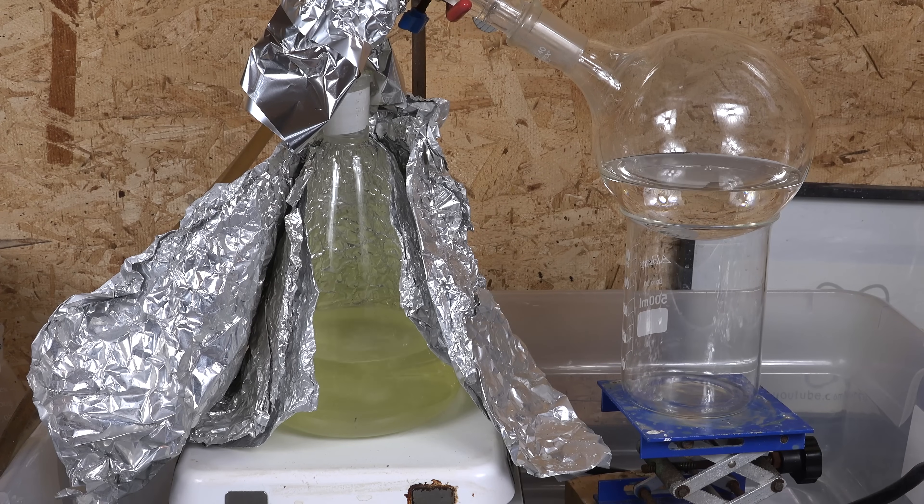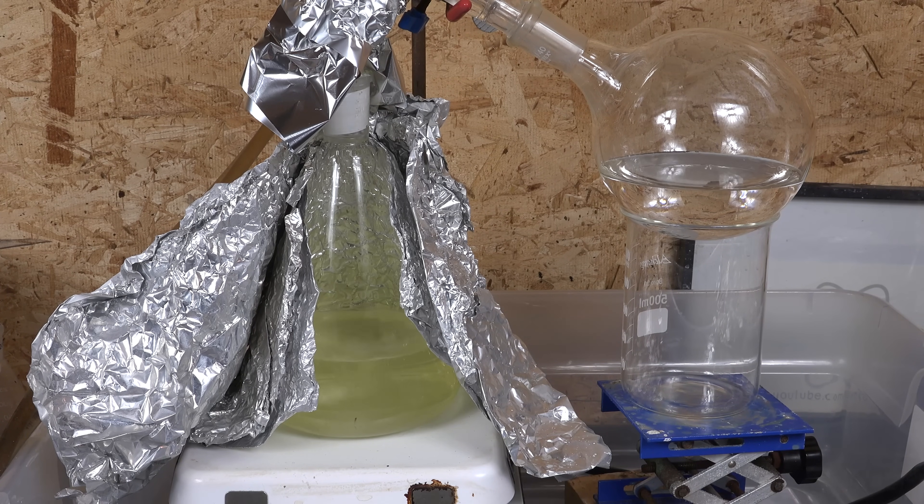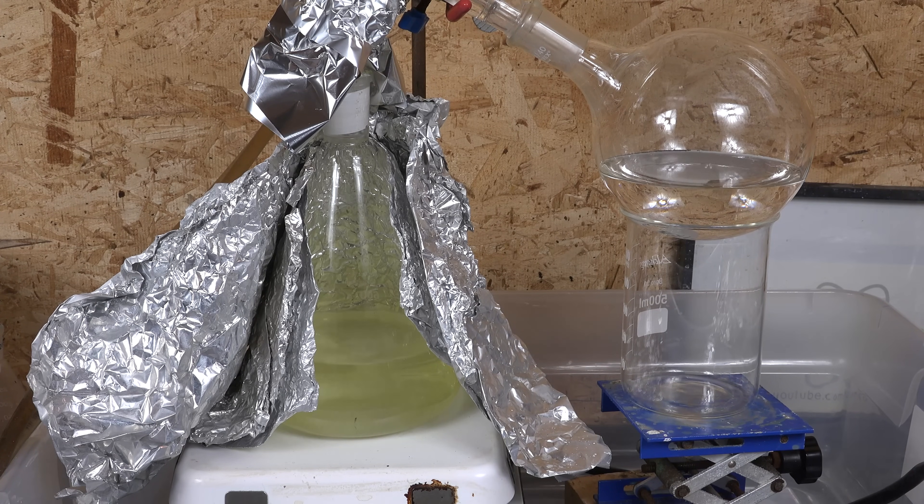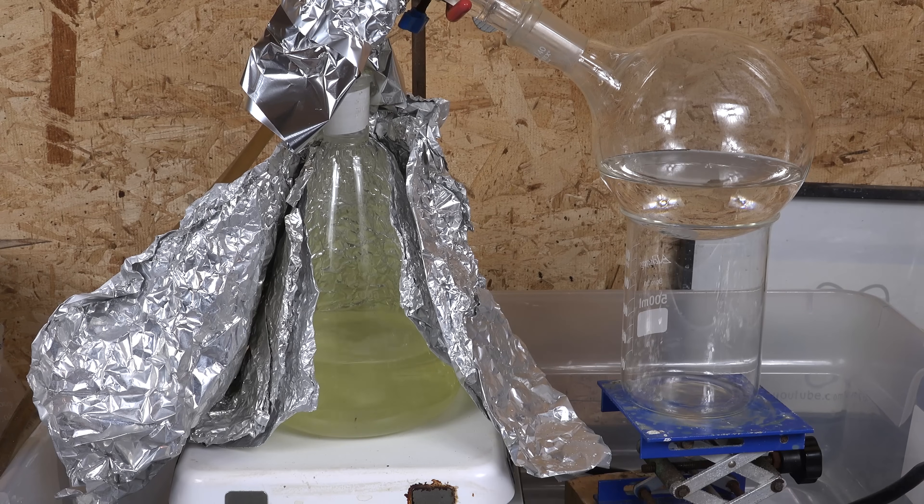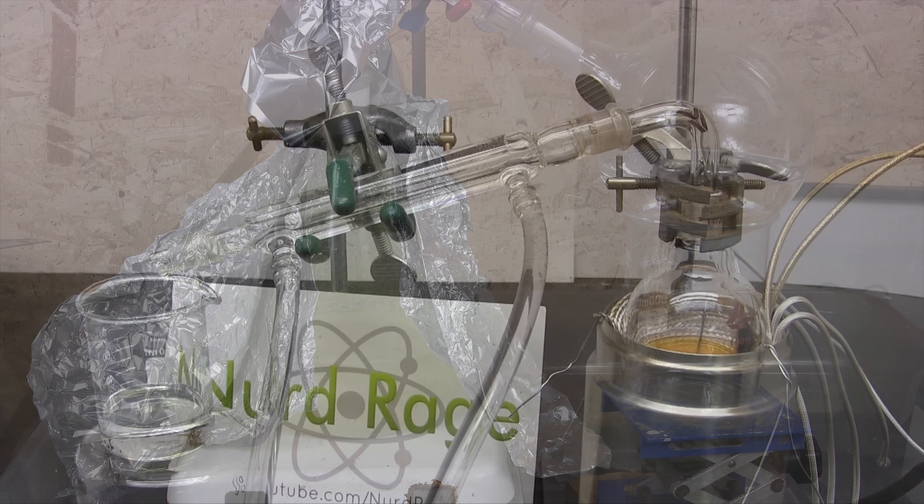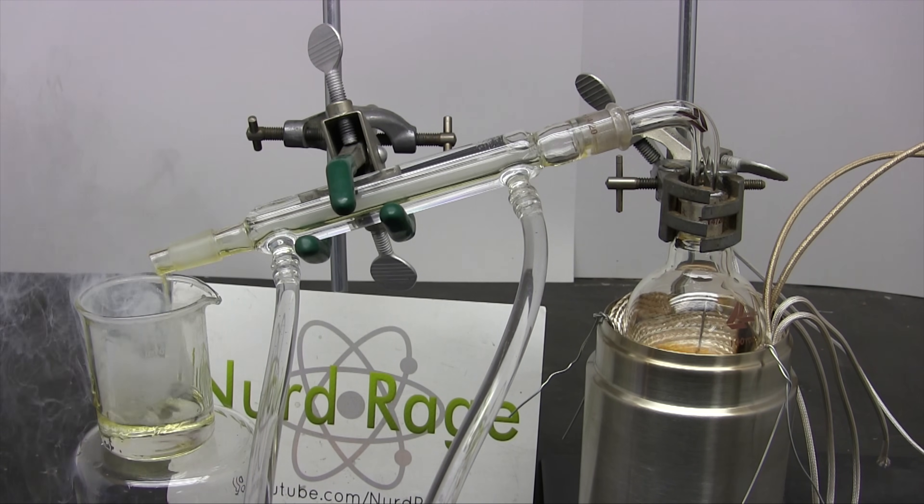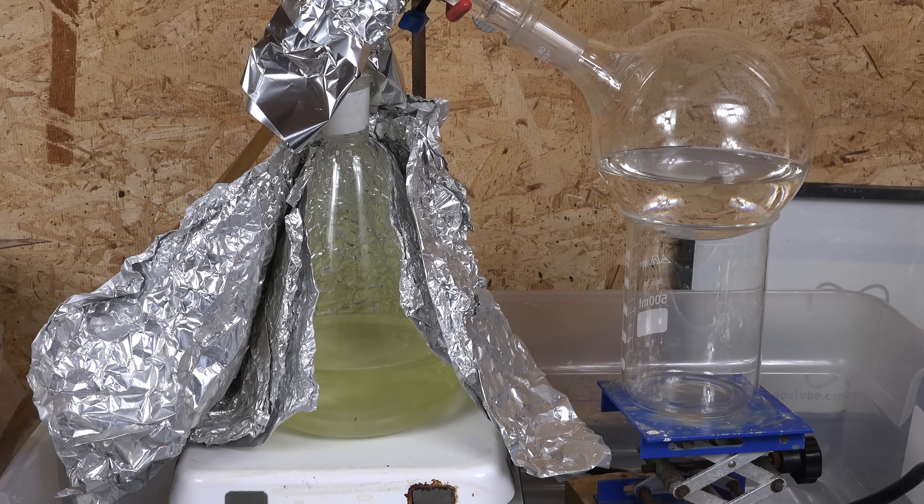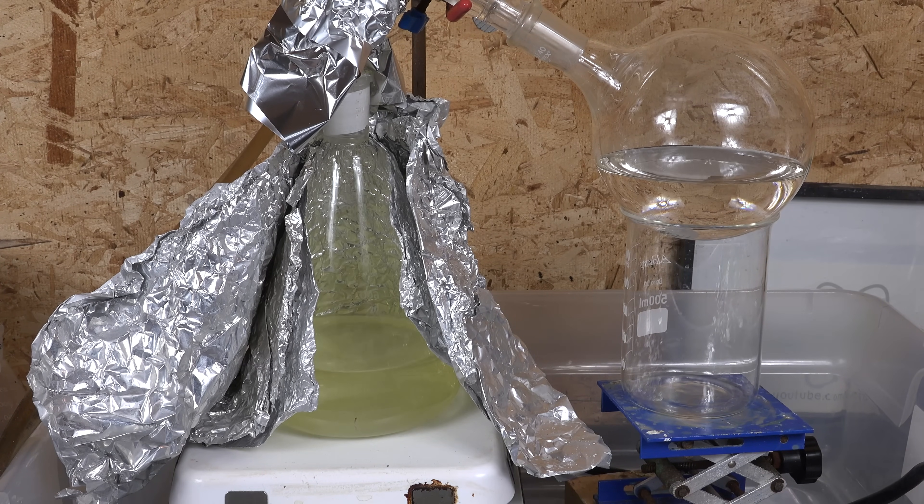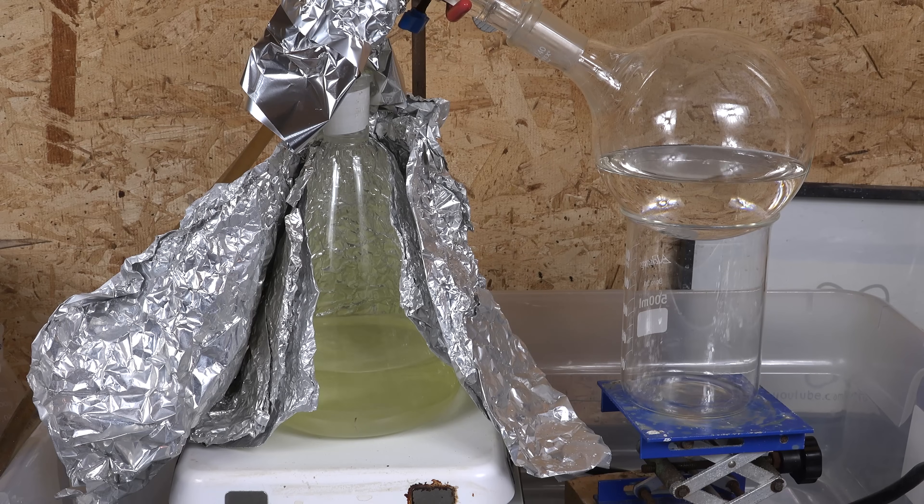Another safety point I want to make is the sulfuric acid vapor. The vapor is extremely corrosive and you don't want it burning your lungs from the inside out. So perform this distillation outside or in a fume hood. In theory the vapor should be completely contained by the apparatus, but in the event of a failure, or even something as mundane as a bump, that vapor will go into the air. Additionally, as explained earlier, there can be a small amount of sulfur trioxide from the sulfuric acid decomposing. It's not much, but it absolutely should not be inhaled.